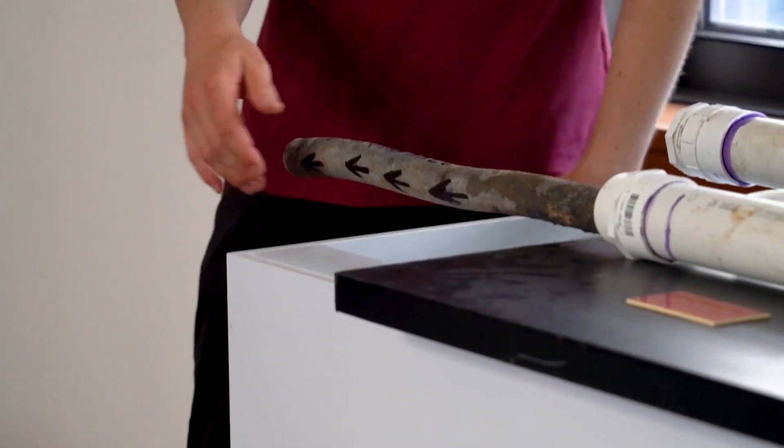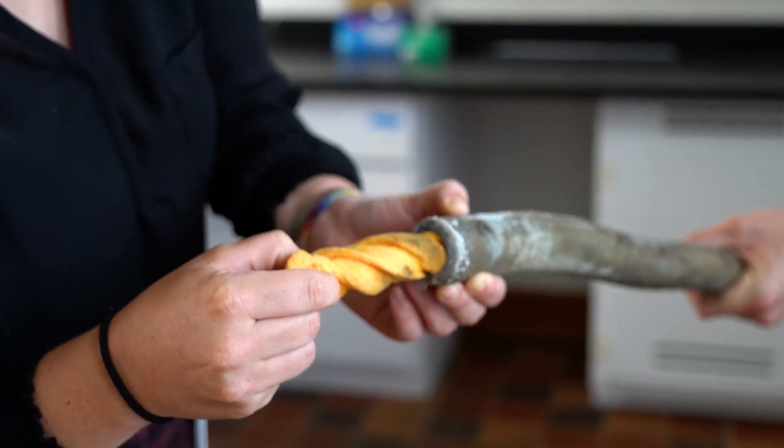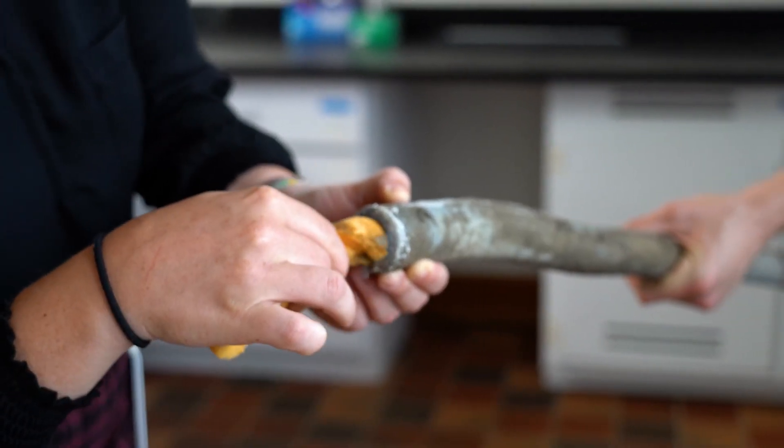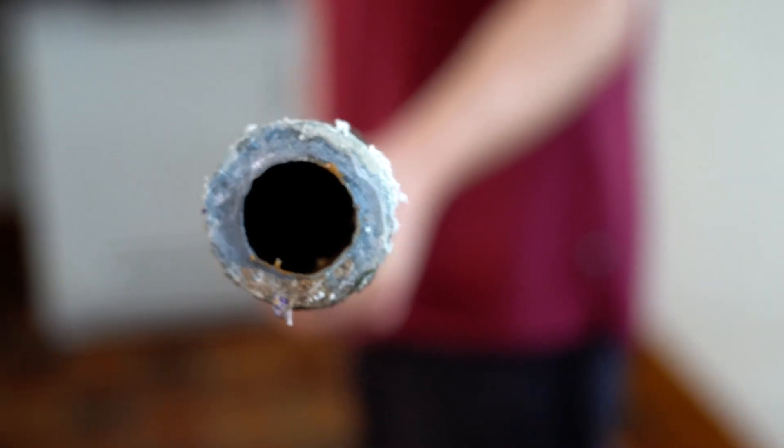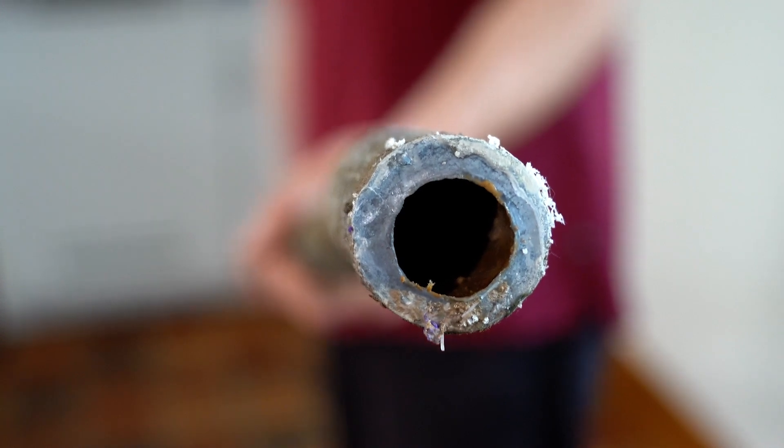The testing phase uses the same flow pattern as the third conditioning phase, only now we're adding the test water qualities to the pipe loops. When the test materials are harvested, they have a scale built up on the interior over many years that contains different elements unique to each distribution system. When they're harvested, these scales tend to dry out, become damaged, and get disrupted. So conditioning flushes water through them to rebuild the scales that were disturbed during harvesting.